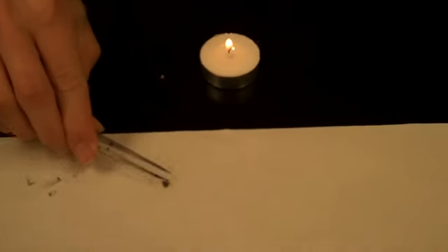And that's how you use a fiber burn test to identify an unknown fiber.